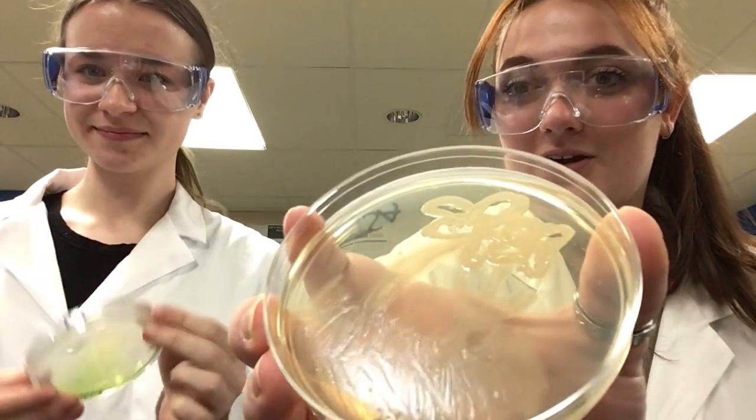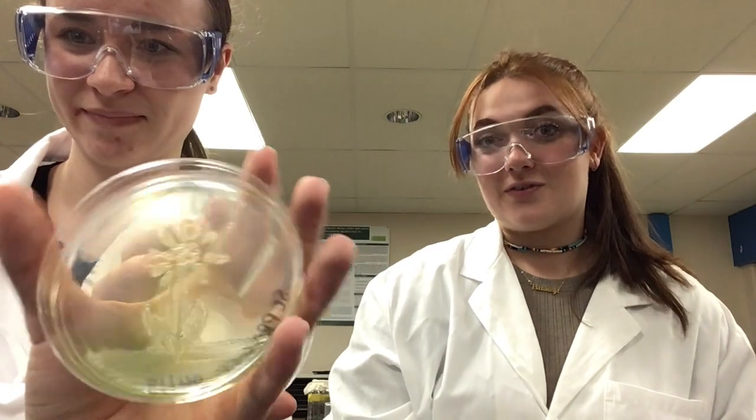So, in the grass section of our flower, you can see that our Pseudomonas fluorescens turned out a lot more green on our Mueller-Hinton plate than it did on our TSA plate. That's because Pseudomonas fluorescens has a green water-soluble pigment, and since the Mueller-Hinton agar has a higher water content than TSA, it's going to be able to pull that pigment out and give us a more vibrant green color.